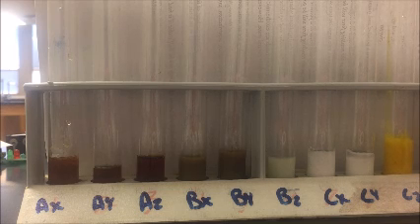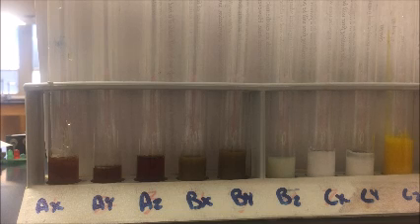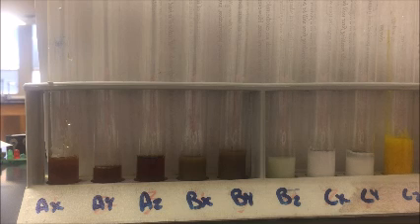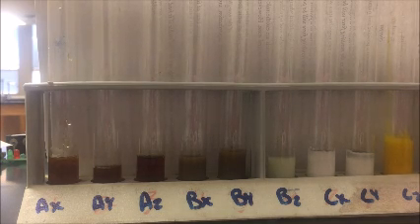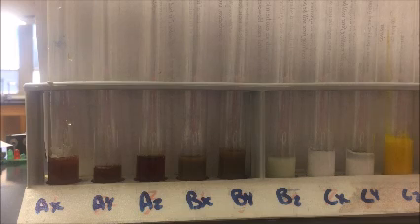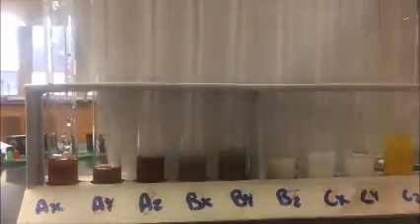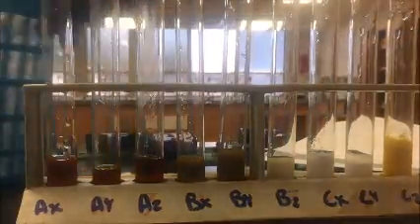So if I mixed A and X together, I mixed iron 3 and carbonate together. And so what I'm going to do then is see what compound I form when iron 3 and carbonate go together. And so you will form iron 3 carbonate. And so what you will do is you will do all of the compounds that I've created here, which you can see something has happened in all of the test tubes, and then you will write down what those are on your lab sheet.